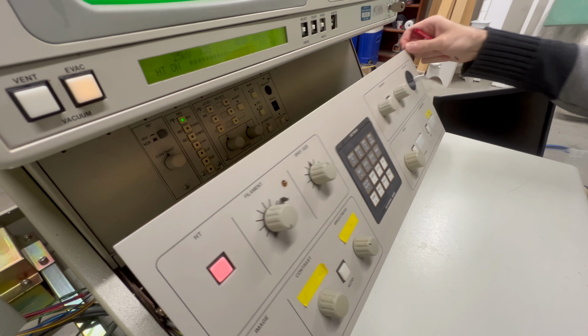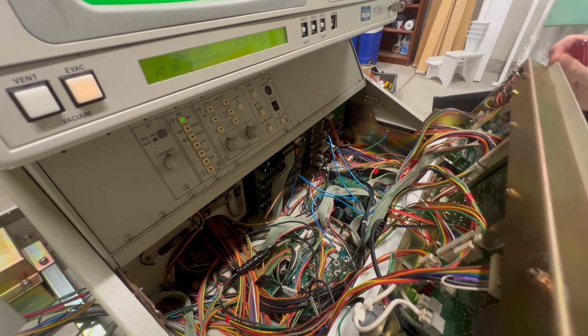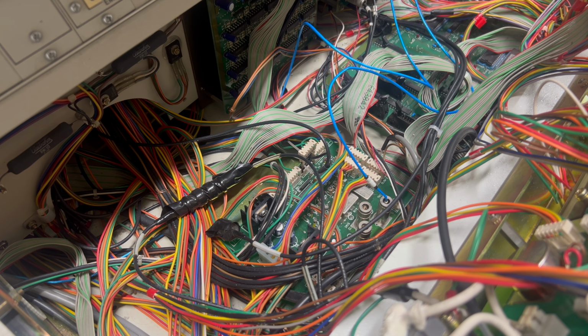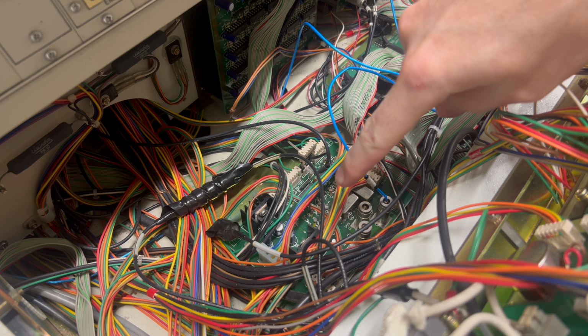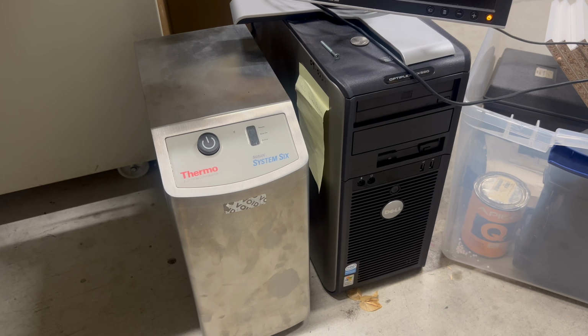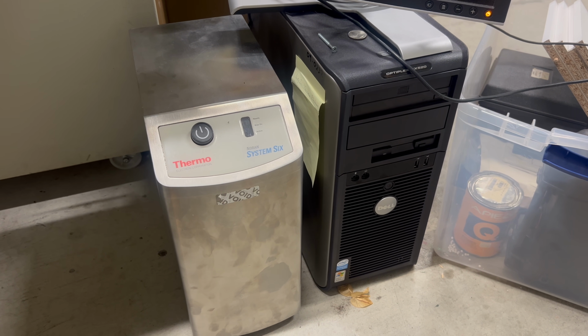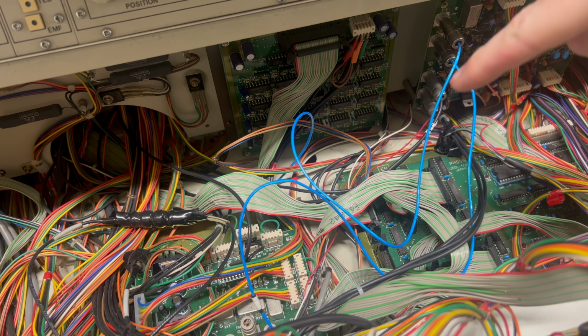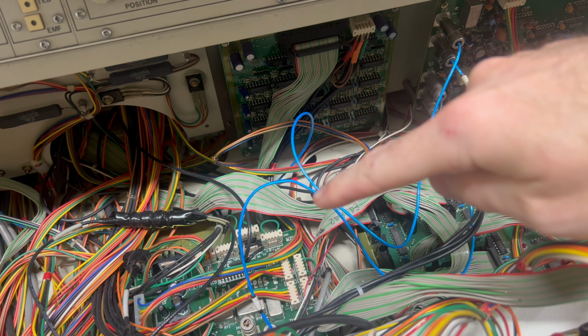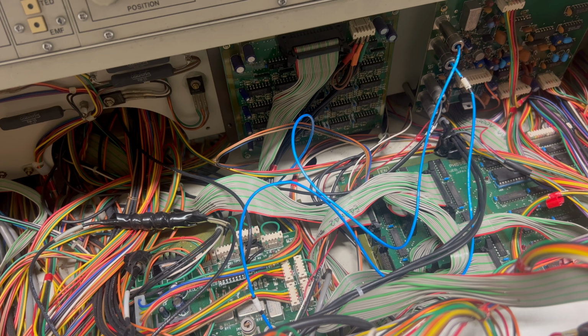Let's take a look under the hood. Oh wow, that is quite a mess. I looked through the schematics and it's clear that this board here is an aftermarket part. It's actually a board that allows this early 1990s microscope to interact with this box, which can send images to a computer. So basically this board intercepts the video signal and reroutes it through this cable, which goes back to the original board. Wait a minute.